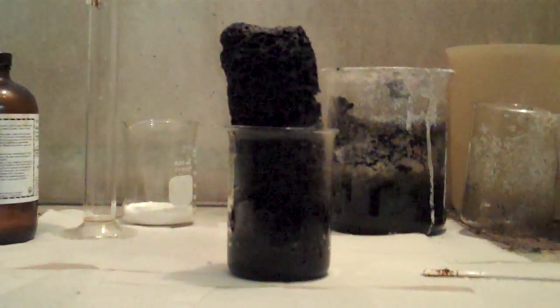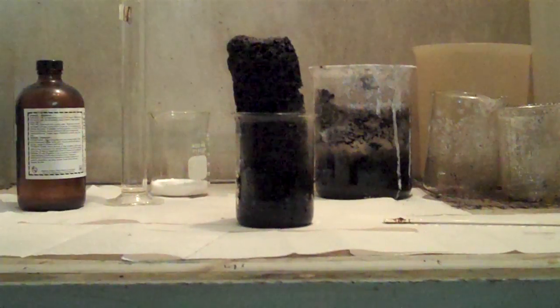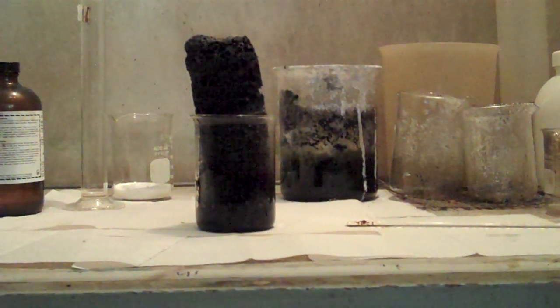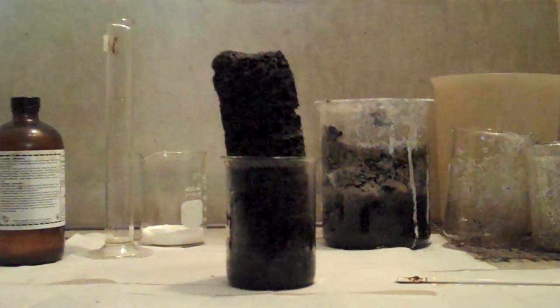It's the rock. Exactly. What did Ujjal say? It's coal. It's coal. So it's carbon. It's pure carbon. Oh, cool. This is what pure carbon looks like. Can we touch the carbon?